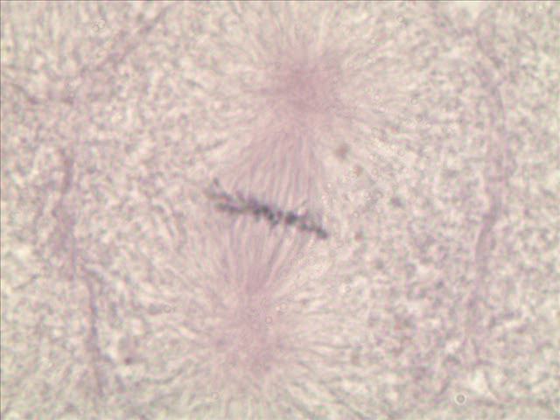What do we have now? Ooh, we've moved on to metaphase. Those coiled up chromosomes that we can now see have been grabbed by these spindle fibers here, spindle fibers here, spindle fibers here, and taken to the equator of the cell, the equatorial plane of the cell. What phase is this again?